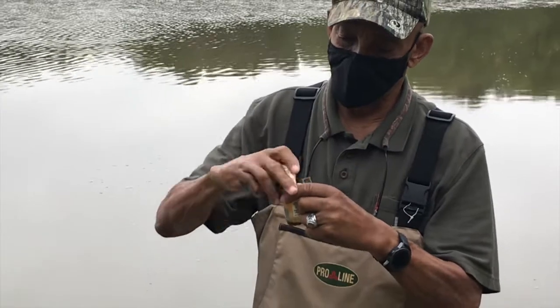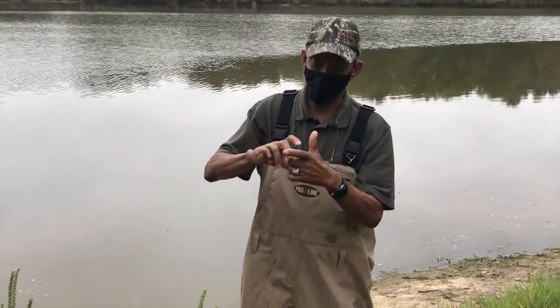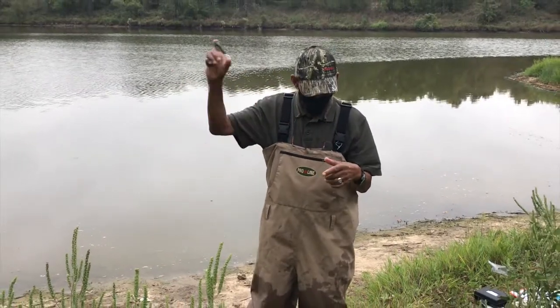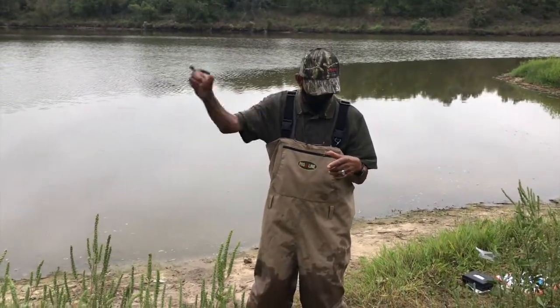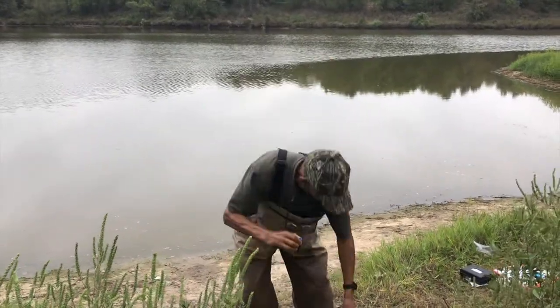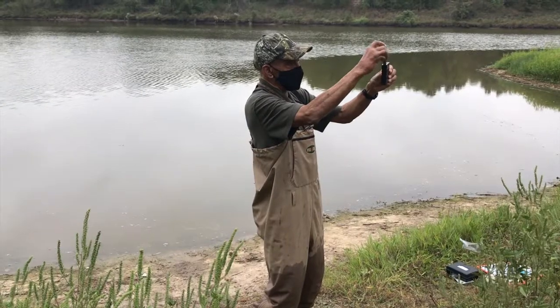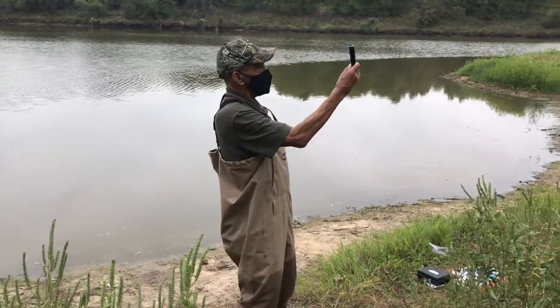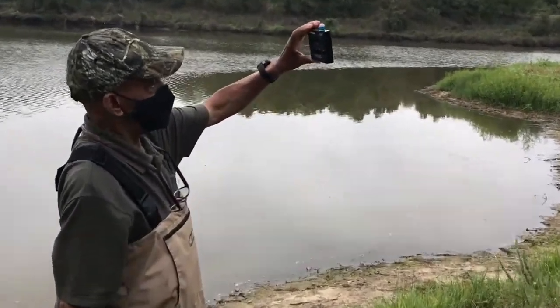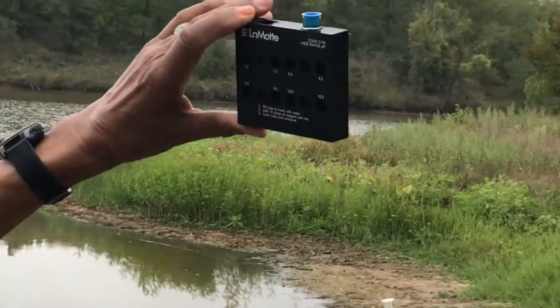Now, I'm going to put the cap into the tube and I'm going to invert it several times. Ooh. I can see that there's a color change. Wow, that's really dark. And I'm going to insert it into the reading mechanism. Oh man. Okay. It's off the scale.